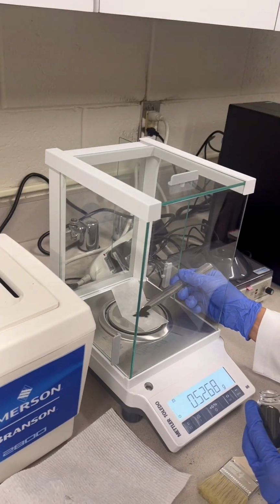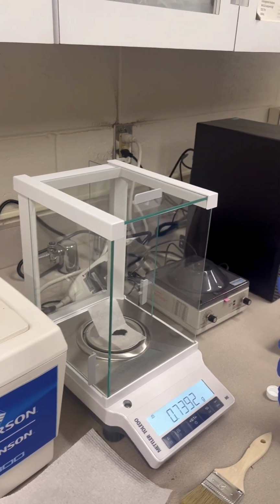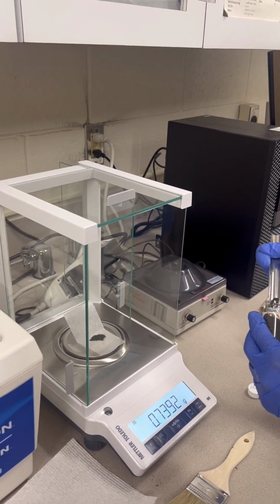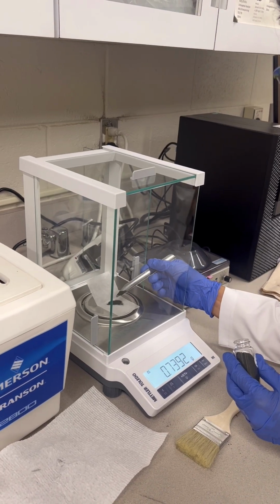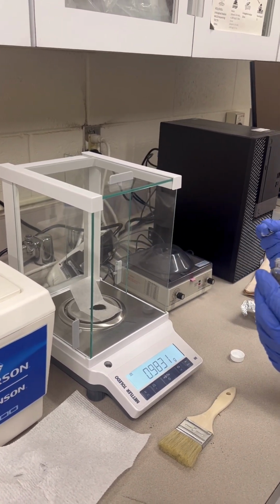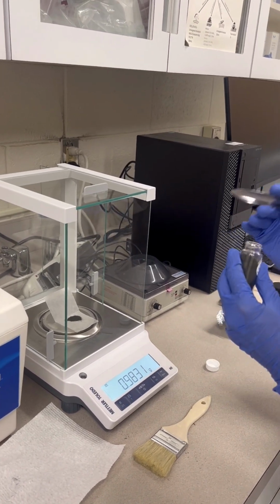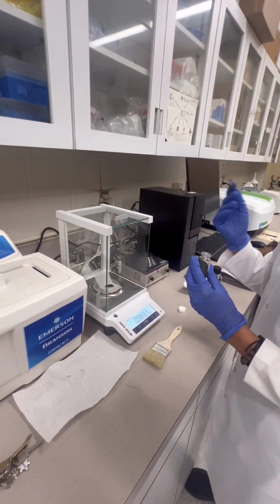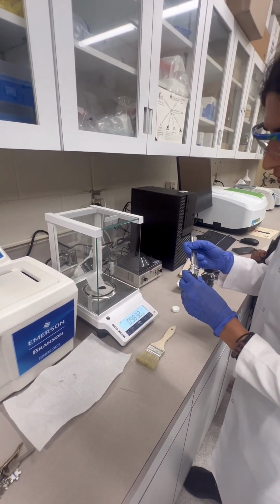So what will happen to the residual potassium permanganate? At the end, we add hydrochloric... we rinse it with, no, hydrogen peroxide to remove the remaining amount. The amount that doesn't react, we need to remove it from the solution.